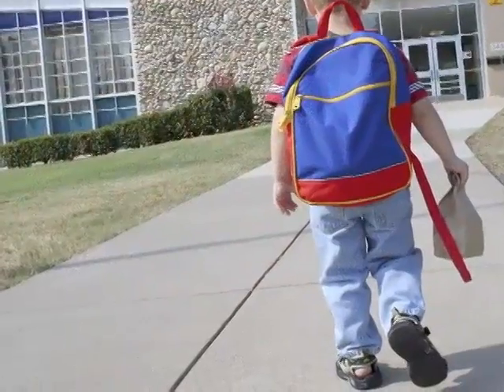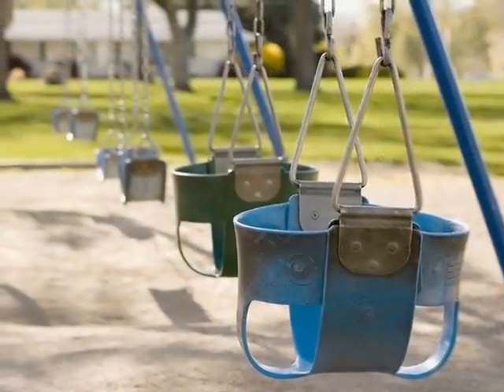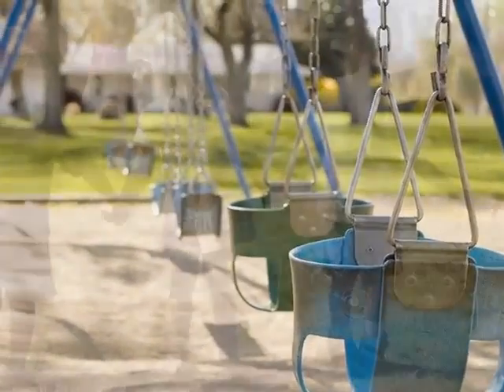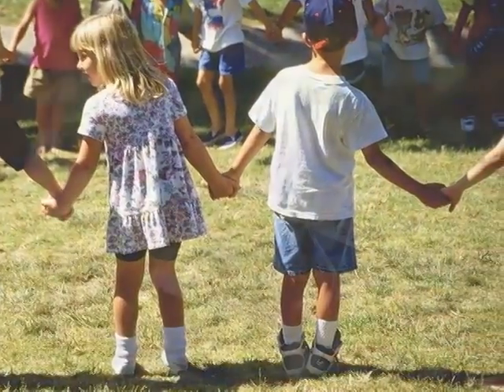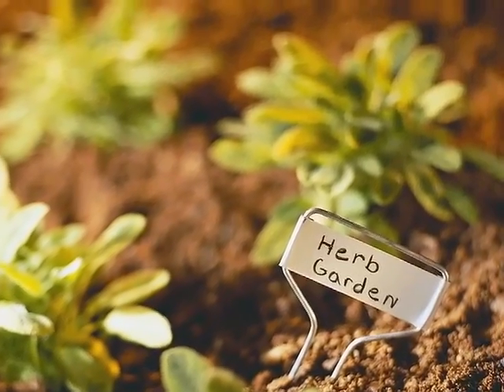It's important to know if the surrounding soil of a community or residential property has potentially dangerous levels of lead or other toxic metals. This is of particular concern if children play on the grounds or if vegetables, herbs, or other edibles are grown in the soil.